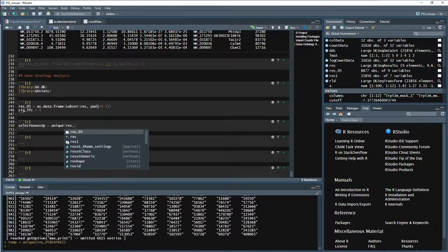Then we'll look in res05. And then we want to search the table. So we're going to do brackets, and then we're going to type res05 again. We're going to feed it a column. So what column are we actually going to base this off of? Well, we have our two thresholds that we set. We have our adjusted p-value of 0.5, and we're only using that table, so we've already done that thresholding. Next thing that we have to do is look at our log fold change, because we set our significant log fold change to 4. So we have to go log fold change. And for our upregulated genes, we want to look at greater than our sigLFC.